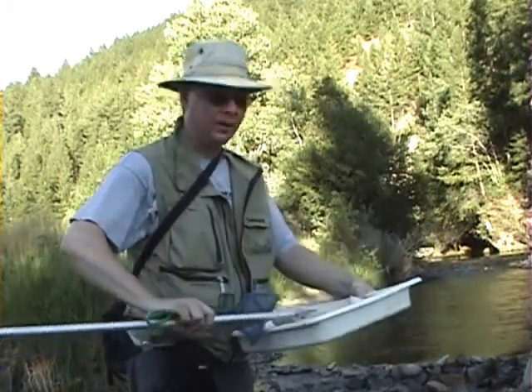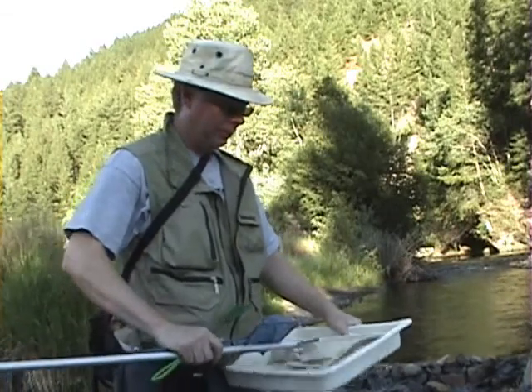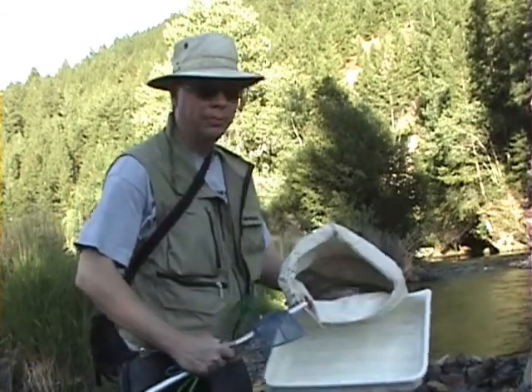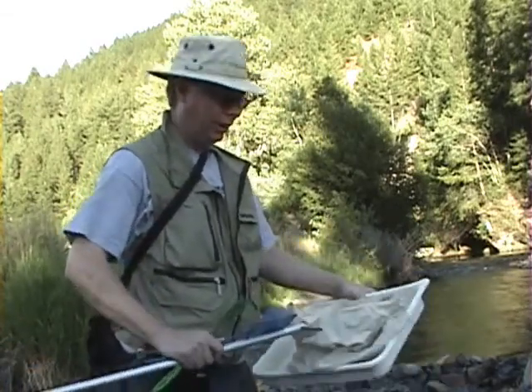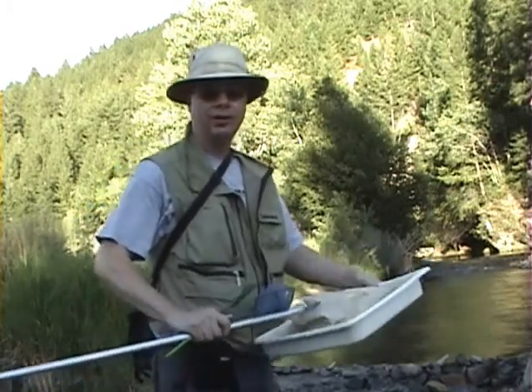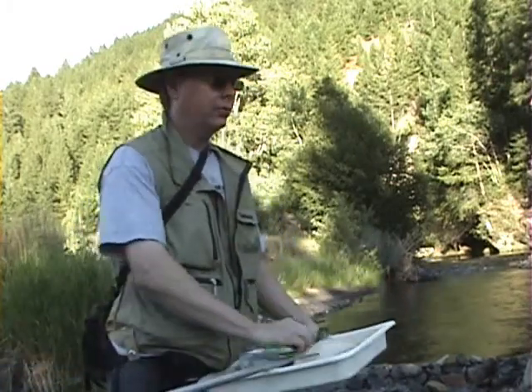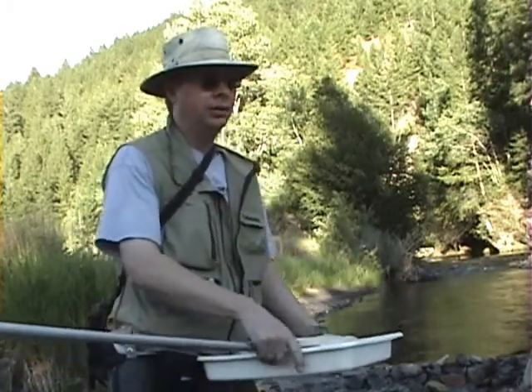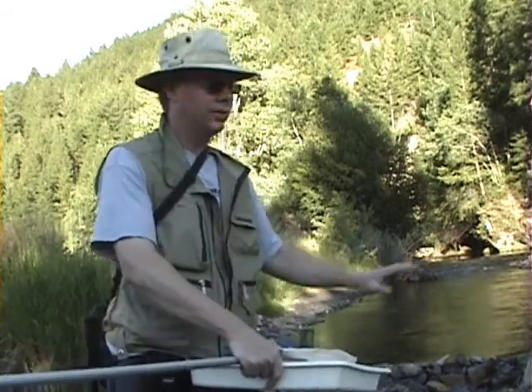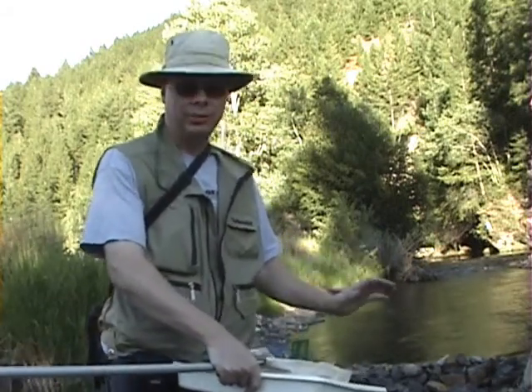This is called a D aquatic sampling net, D shaped net. A fairly small diameter of mesh and a fairly wide girth, so this can collect a lot of insects at one time. What we're going to do here is we're going to go into the stream, different parts of the stream, and do some kick sampling.